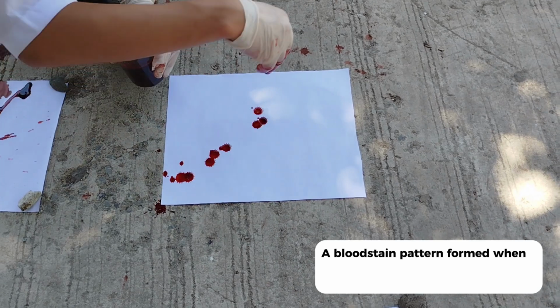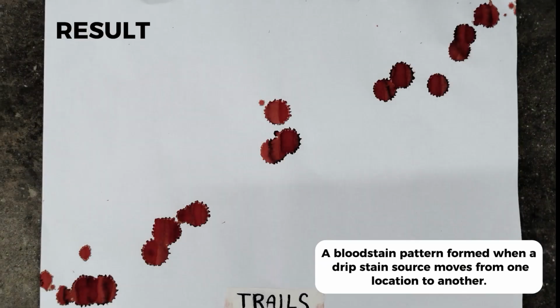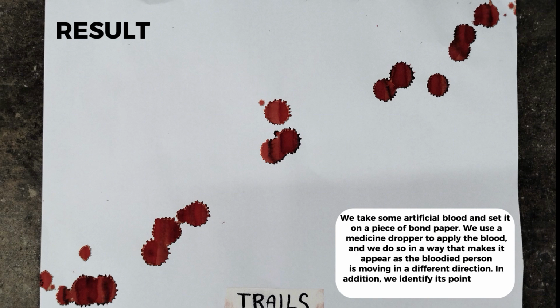A bloodstain pattern formed when a drip stain source moves from one location to another. We take some artificial blood and set it on a piece of bond paper. We use a medicine dropper to apply the blood, and we do so in a way that makes it appear as if the bloodied person is moving in a different direction. In addition, we identify its point of origin and direction.